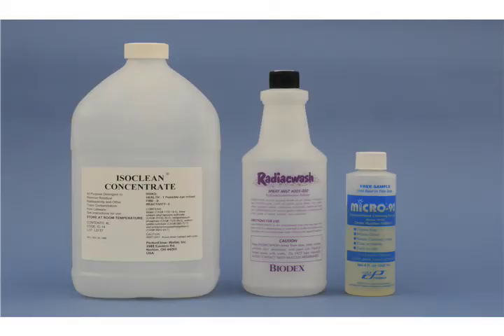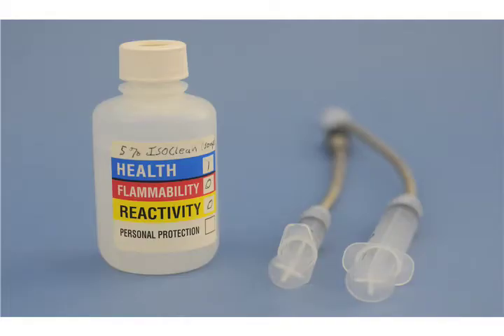Particle Measuring Systems recommends using a simple laboratory grade glassware cleaner, such as Micro 90, to create the cleaning solution. Other products that have been used successfully are ISOClean, Radiac Wash, and Mr. Clean. Mix up to a 5% solution of cleaning fluid with water.